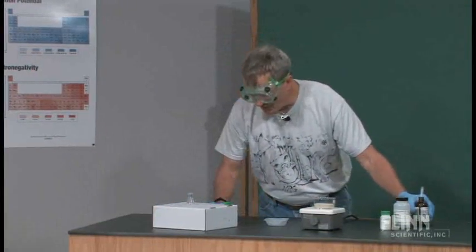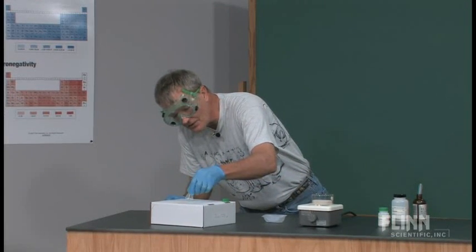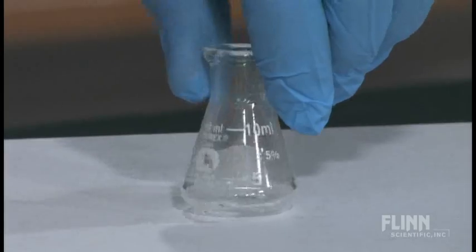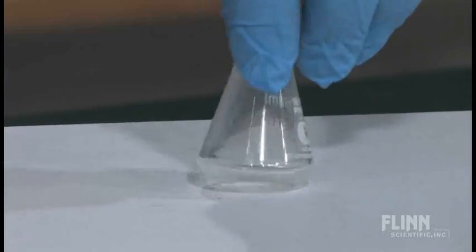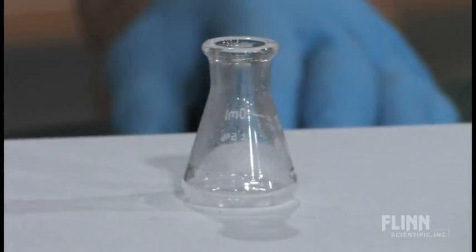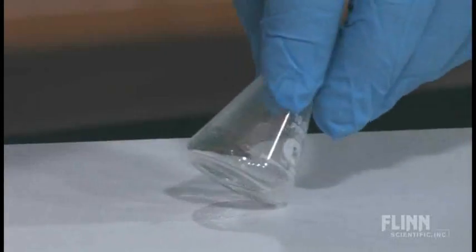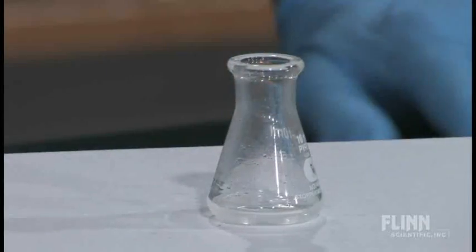So I'll set this out of the way. Instructions then tell the students to wait until the reaction is complete. And they can tell it's complete because they won't see any bubbling occurring any longer. And this is getting pretty close. There are still a few small pieces left that are bubbling, so we'll let it sit for just a second.